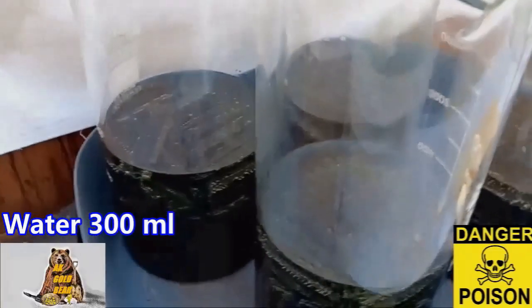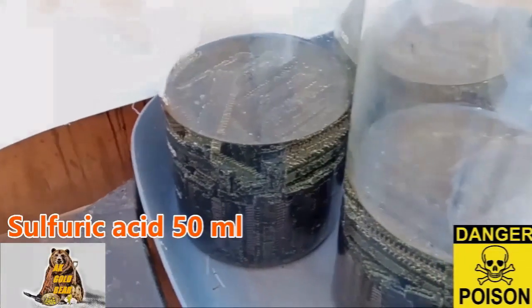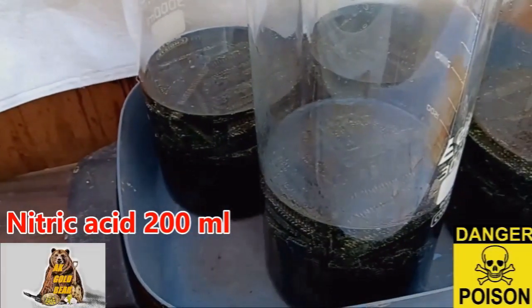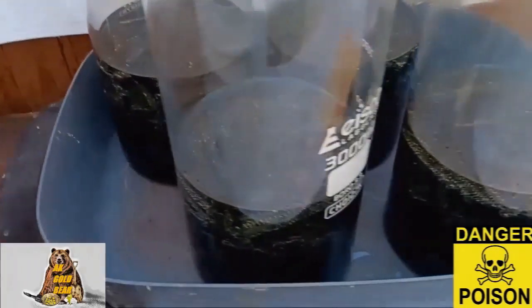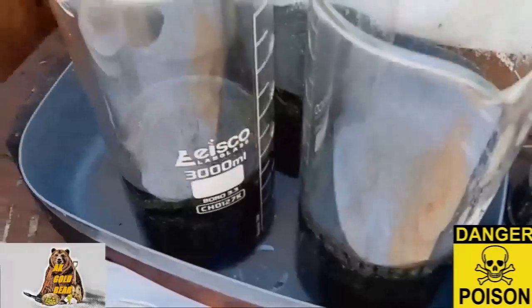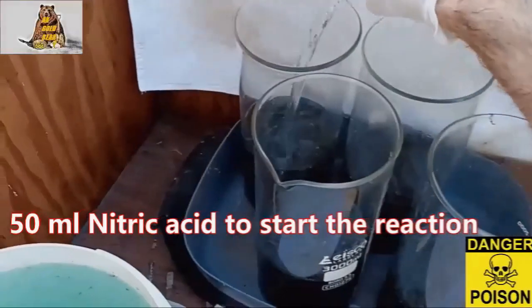Now about the connectors. I add 300 milliliters of water, 50 milliliters of sulfuric acid, 600 milliliters of hydrochloric acid, and 200 milliliters of nitric acid. My aqua regia will include sulfuric acid because the pins are slightly magnetic. There you go — 50 milliliters of nitric acid to start.